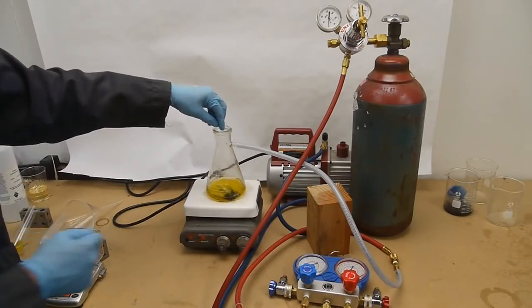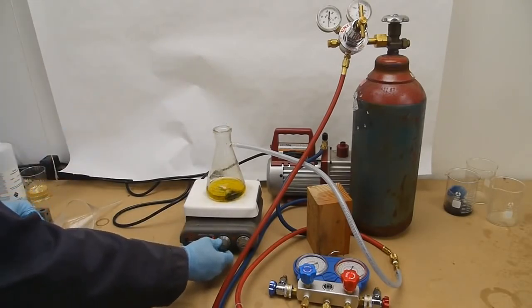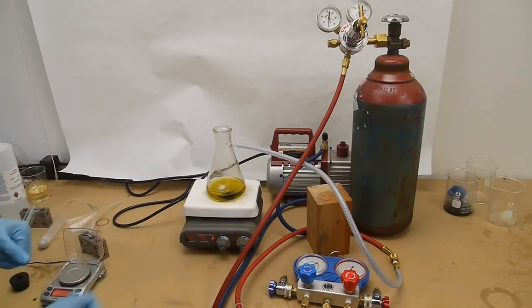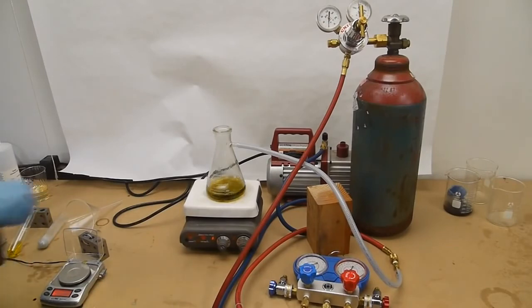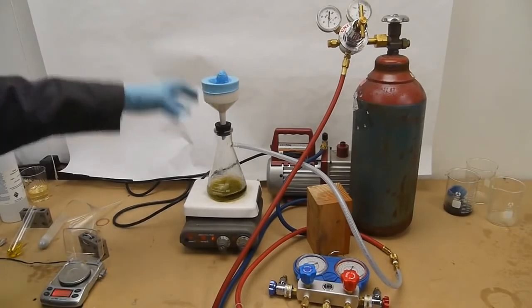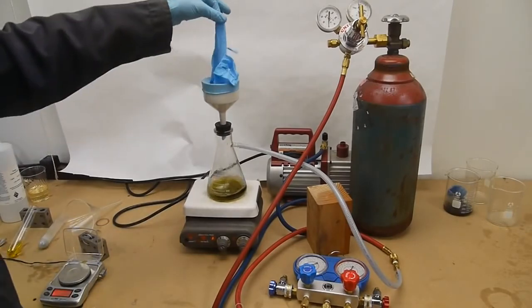I'll drop in a stir bar, and I'm not going to use heat on the hot plate—this is just going to be stirring today. We'll add a cork and this funny contraption. I didn't have a balloon to put on top, so I'm just going to use a glove.